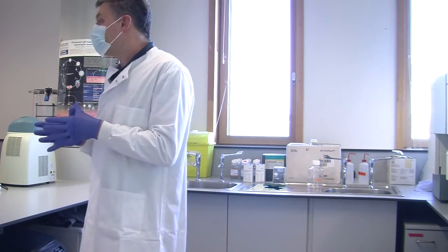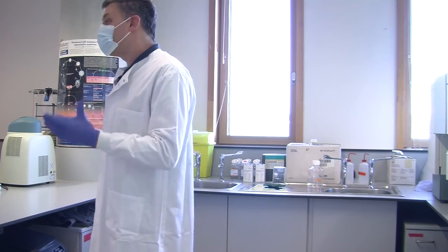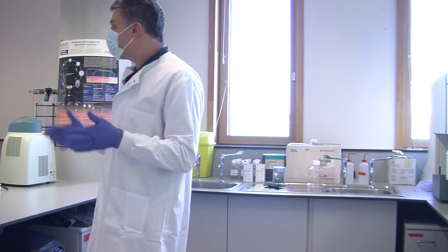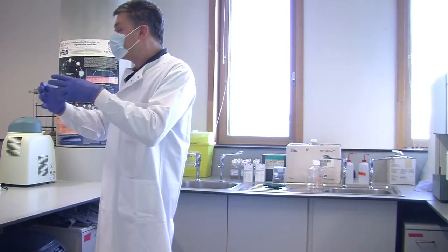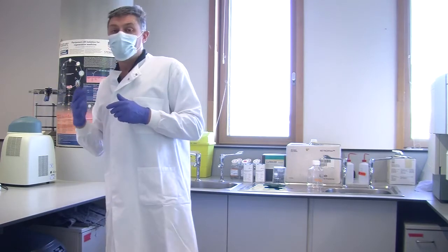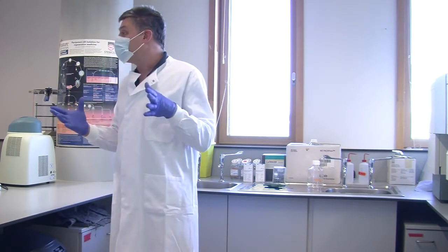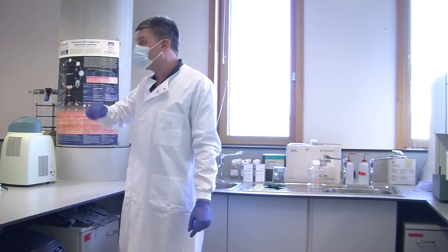Now in a research lab, you'd never use it because you tend to be running experiments that have 5 or 8 or 10 tubes in. So for those, you'd use the lesser automation of the other systems, where you can have a tube rack. So one of the instruments I've been demoing to the staff here to potentially buy, you can put a 24 tube rack on, click go, and it just reads all 24 tubes.